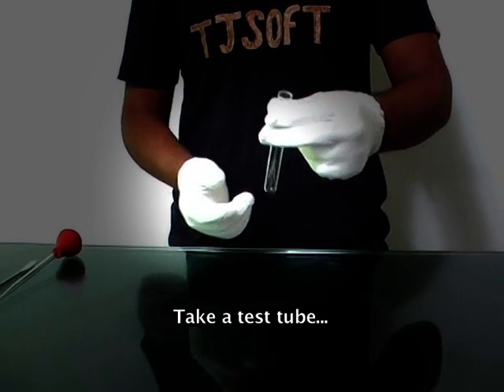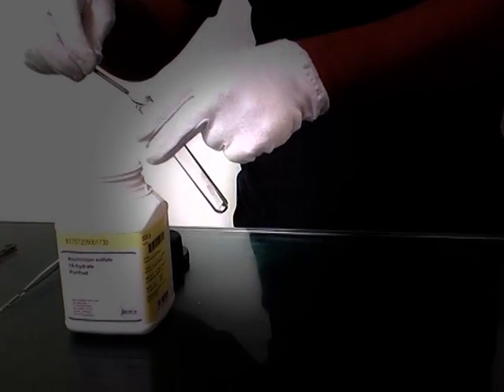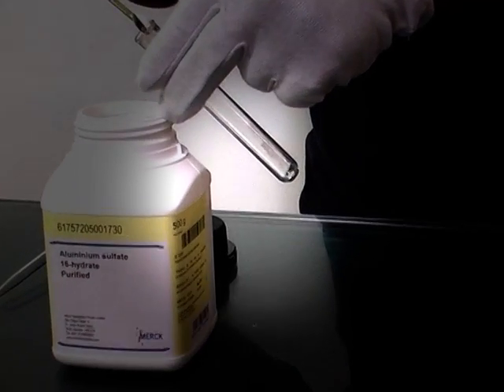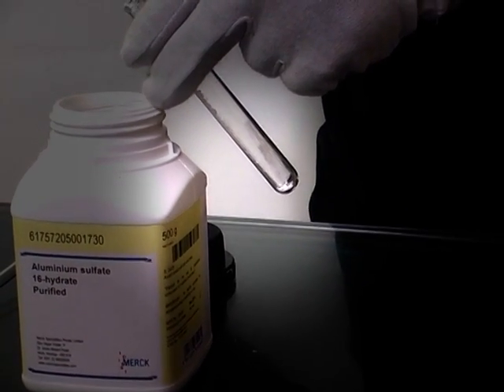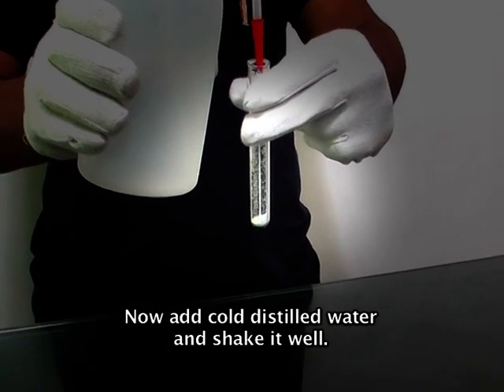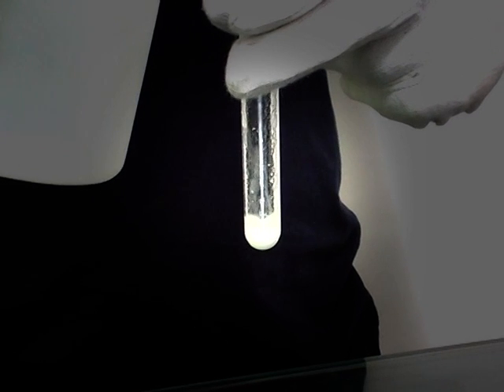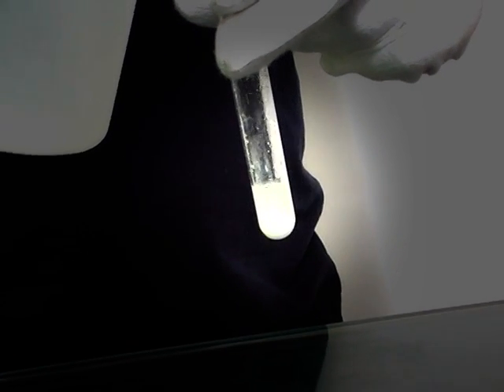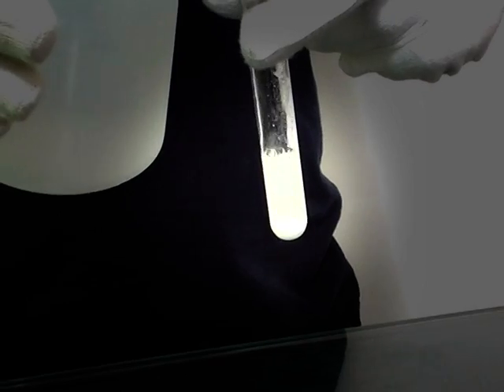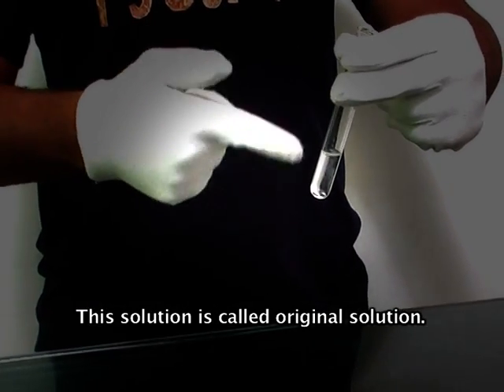Take a test tube. Now add a little amount of salt with the help of a spatula. Now add cold distilled water and shake it well. This solution is called the original solution.